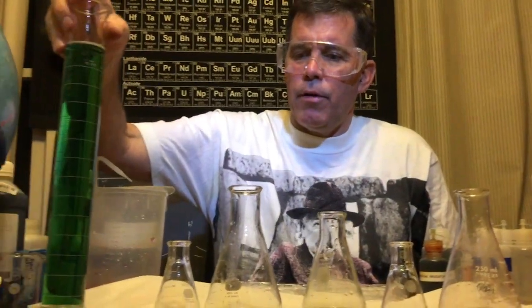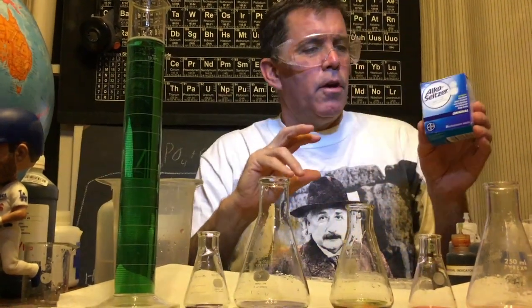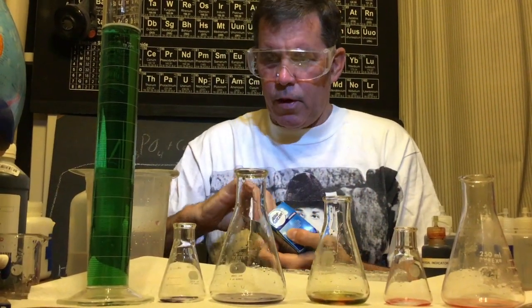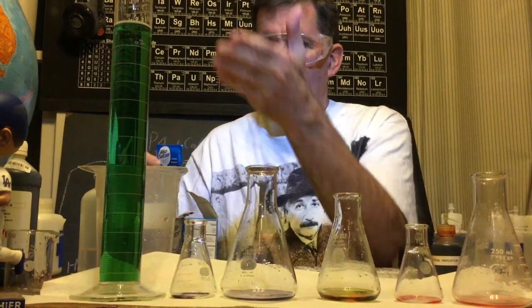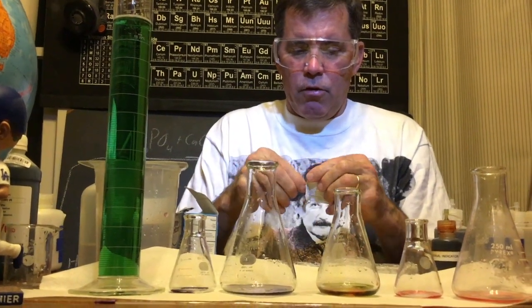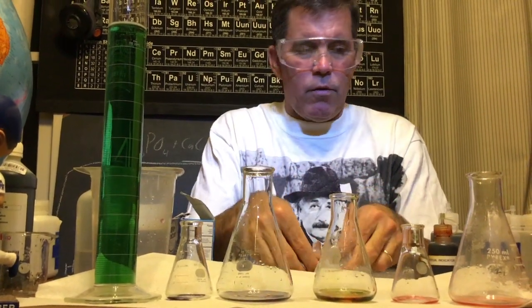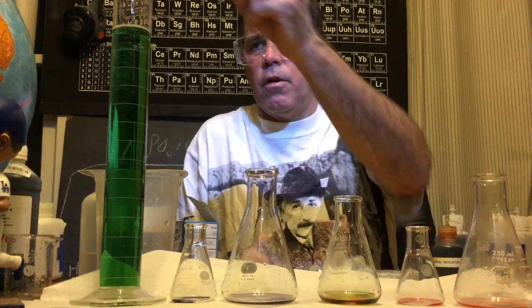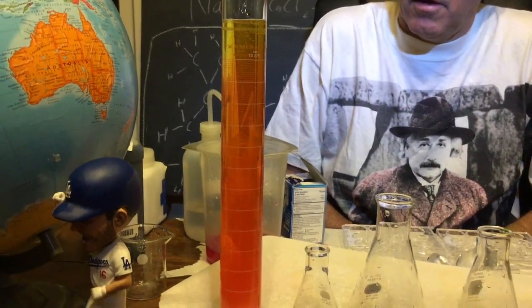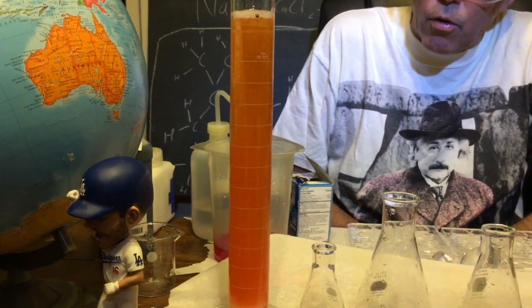Now maybe right about now you're getting an upset stomach and you're just wondering if it's time for a commercial. So I have this antacid to help you with your upset stomach. And I wanted to put it into a graduated cylinder with universal indicator, just for fun. What's going to happen? What colors do you think it will form? This is one of the reasons why I love chemistry, because of the colors. So let's just plop it in and see what happens. Ooh, look at that. Can you see the red, the pink, the orange, the yellow?